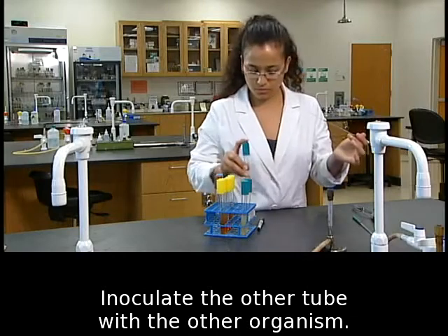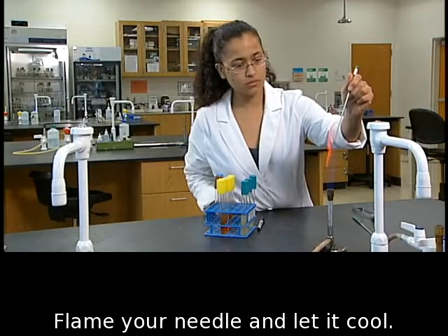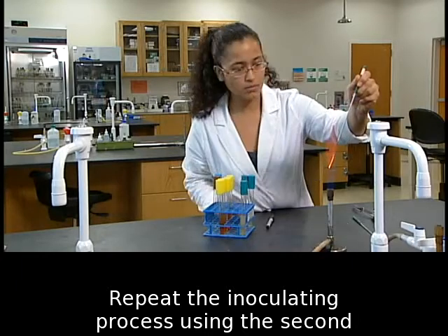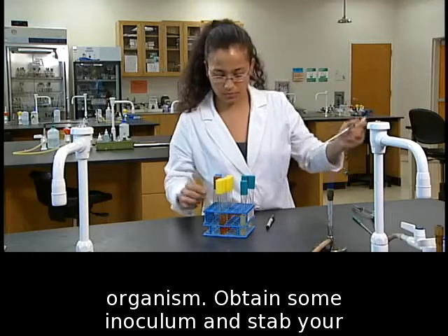Inoculate the other tube with the other organism. Flame your needle and let it cool. Repeat the inoculating process using the second organism.